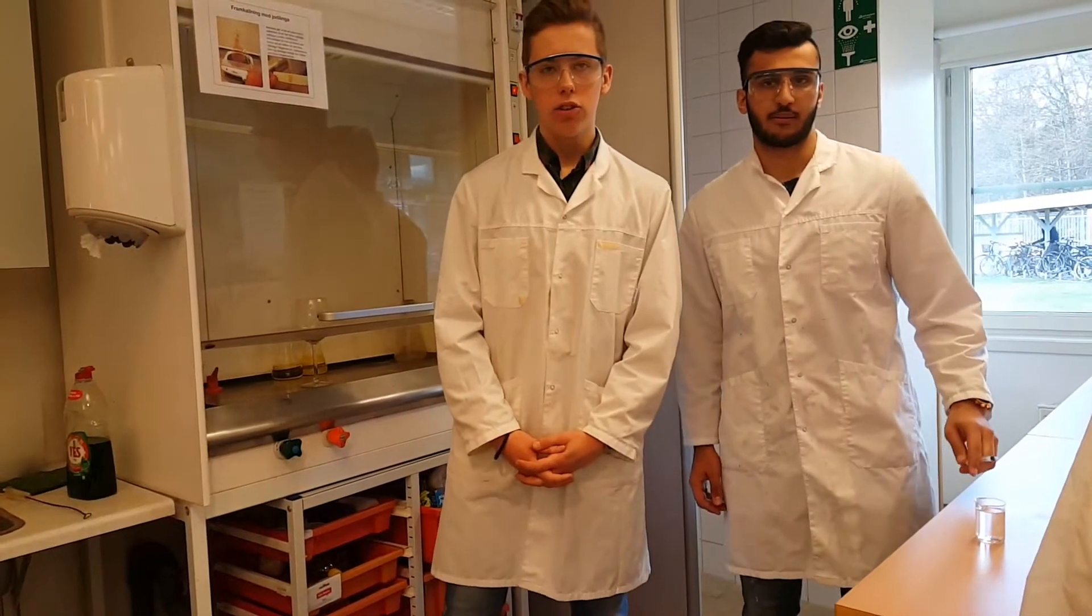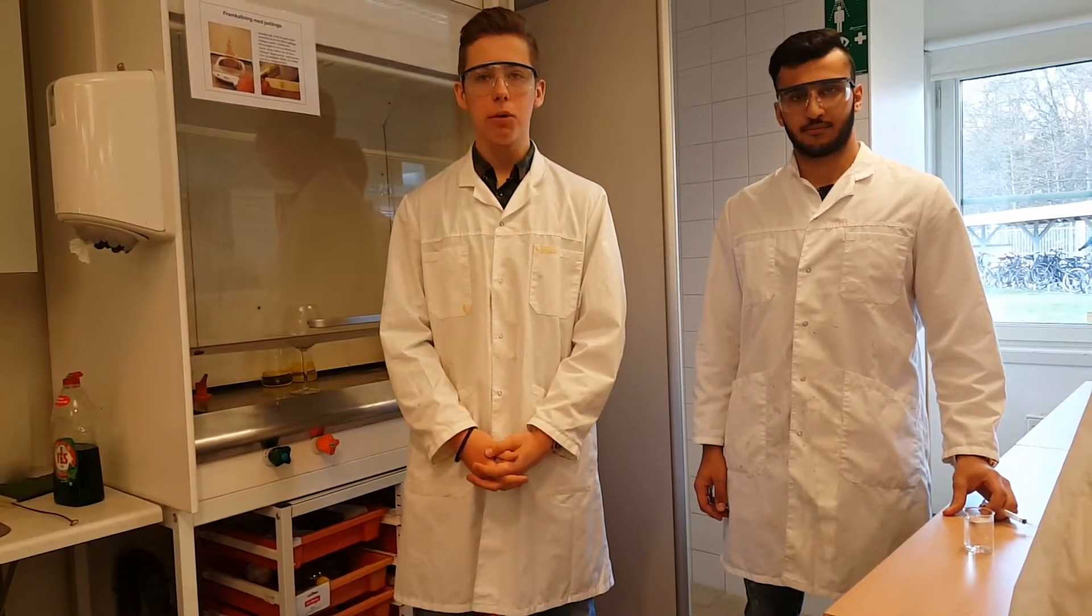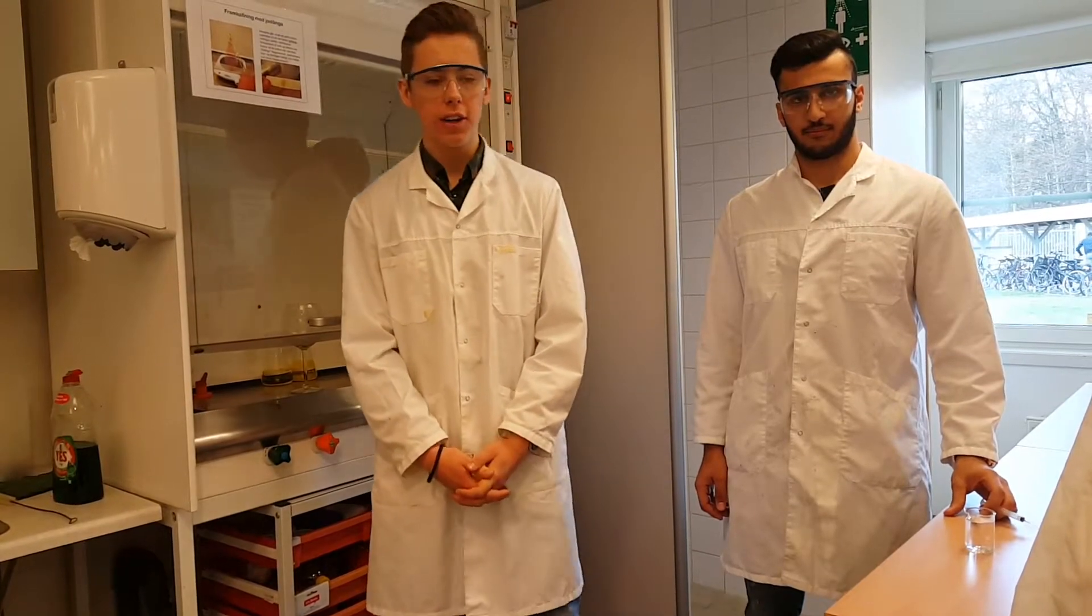Thanks. So, now when we have all the right safety equipment, Richard will show you what happens when we put two drops of water inside the wine glass.